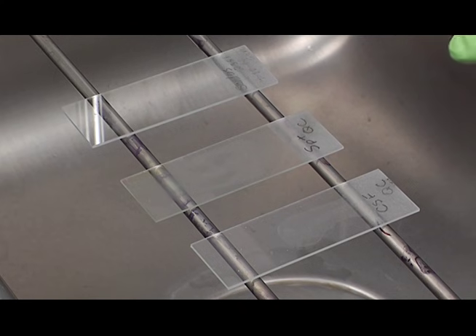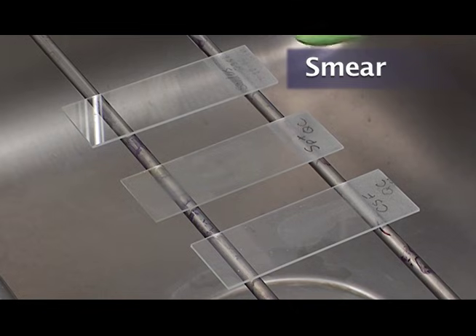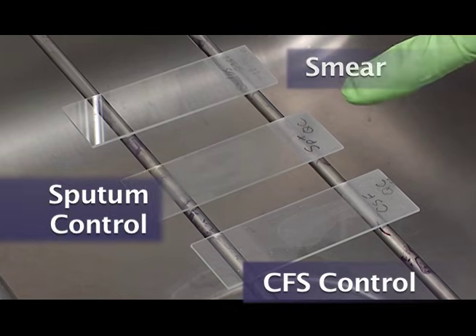Now I've put my smear here next to my two controls, a CSF control and a sputum control.